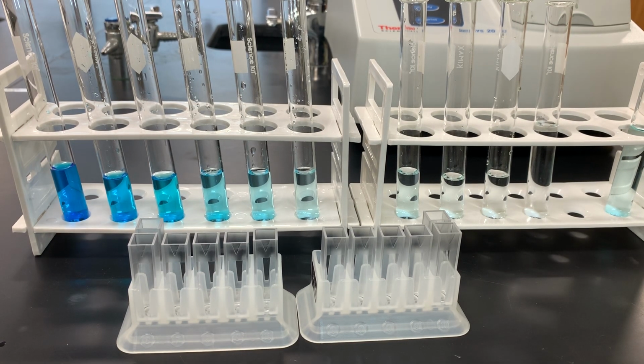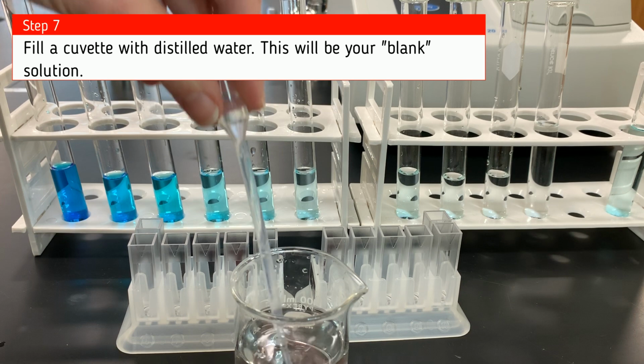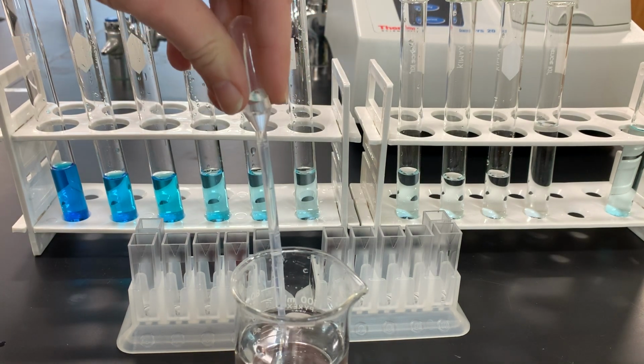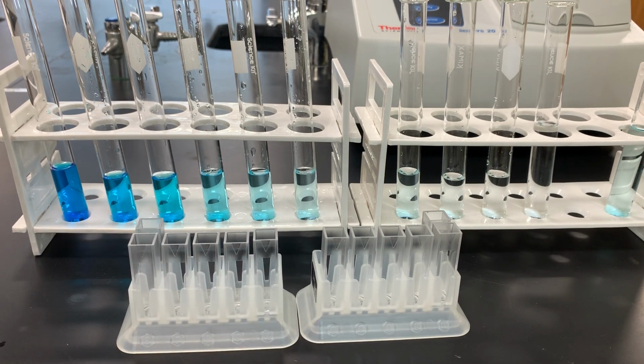So in front of me now I have 12 cuvettes. Cuvettes are the way that we will be getting these samples into our spectrophotometer. The first cuvette, I'm going to add distilled water. This is going to be my blank cuvette, kind of like how you hit 0 or tare on a balance. This is how we will zero out the spectrometer.